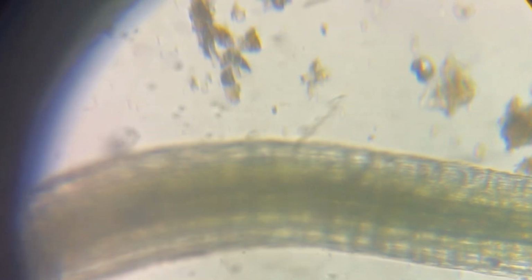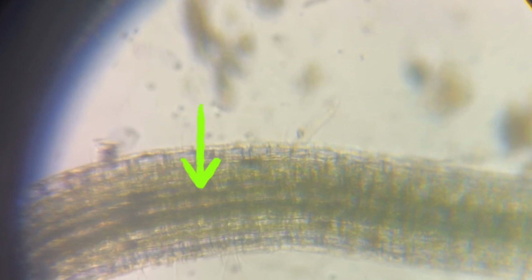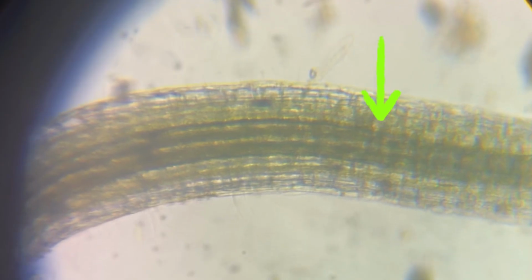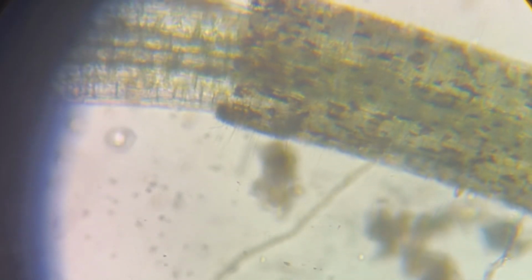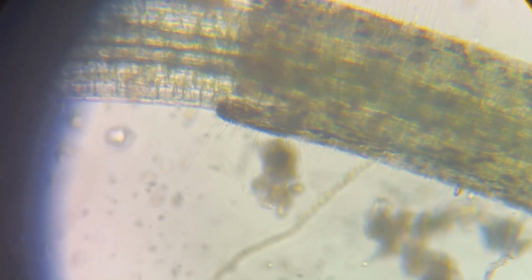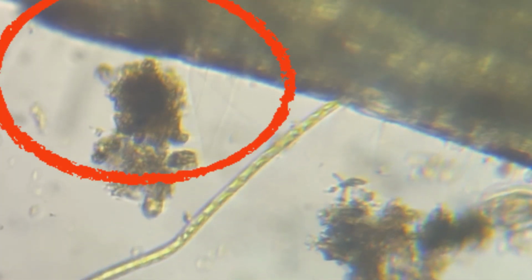Now, as the footage comes into focus here, you will see a stem of a little bit of moss. The arrow here is showing the xylem cells of the stem, and these are little tiny cells whose job it is to transport water. A very important job for any plant to complete a process called photosynthesis, responsible for the oxygen in the air that we breathe.